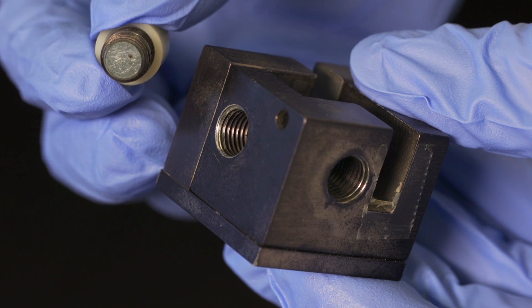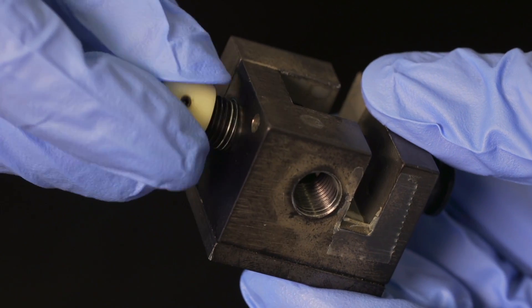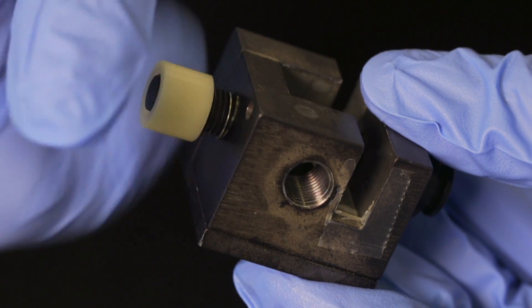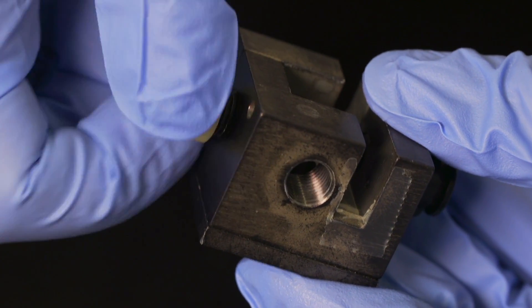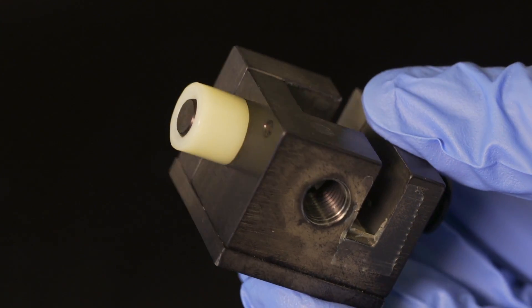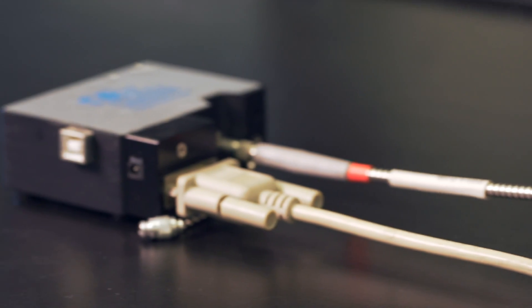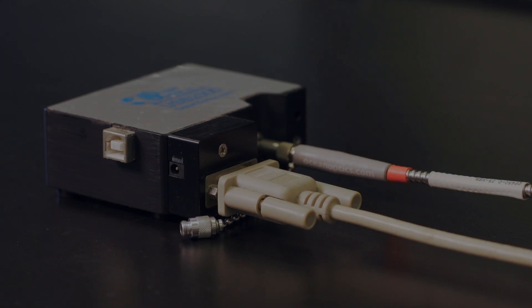Mirror plugs are used to increase the signal to noise ratio by reflecting some emitted photons over to the fiber optic cable, and by blocking outside light from entering the cell. Once in the fiber optic cable, the light beam travels towards the spectrometer where it is detected.